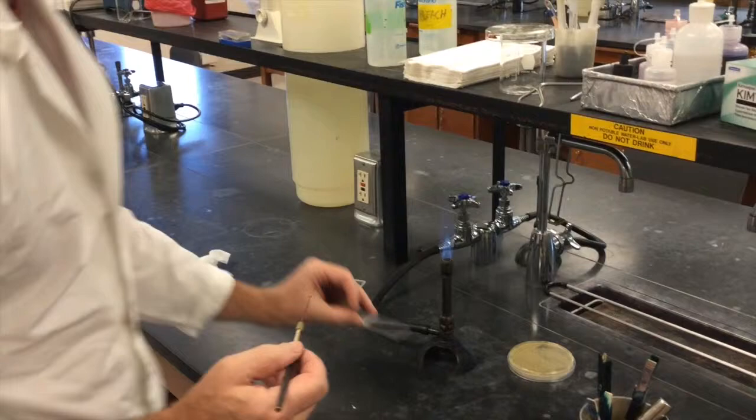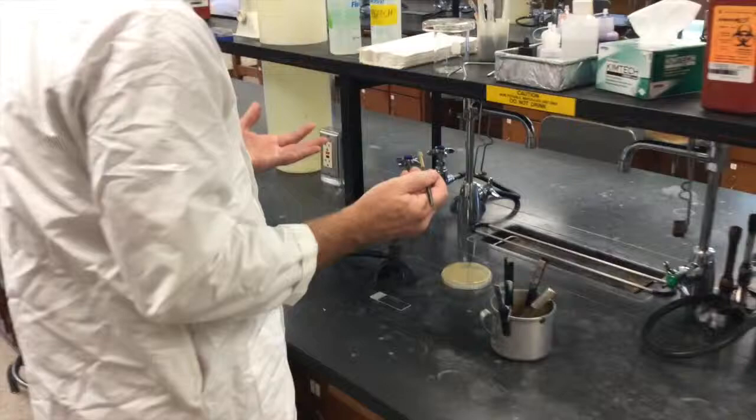And you don't need to spread this out very much. A broth is not very concentrated so you don't really need to spread it out very much.